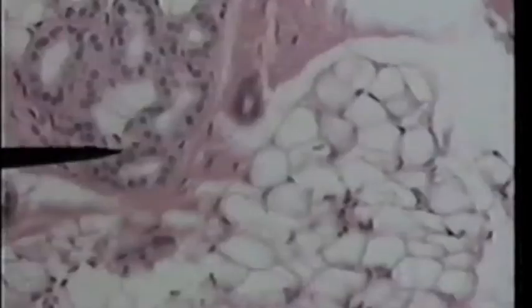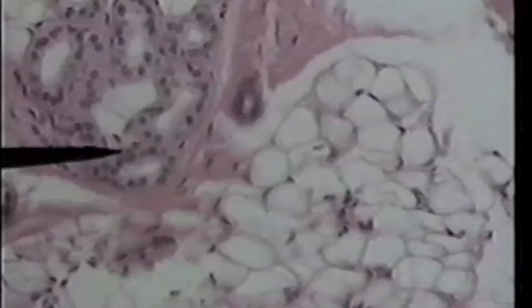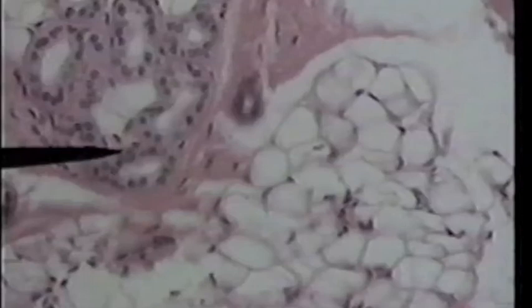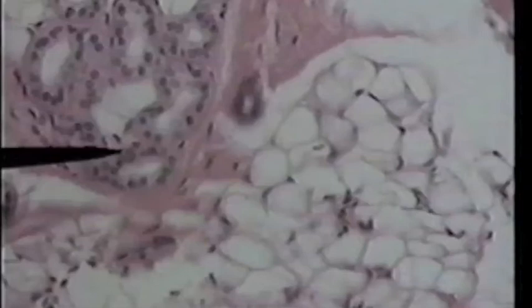Now the pointer is on a sudoriferous gland on high power, and you can see that it's just simply a coiled tubule that has been cut in cross section. Secretions from this gland move through a duct to the surface of the skin, and that's how the sweat is excreted.